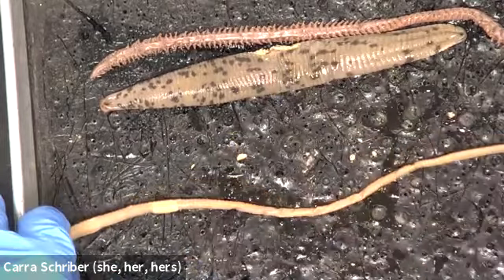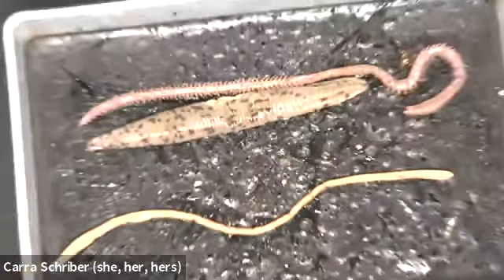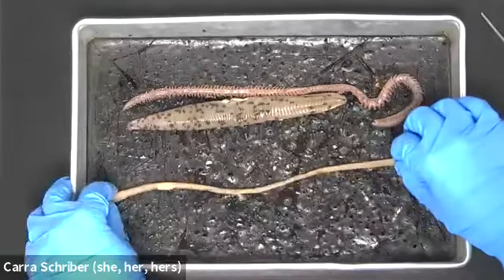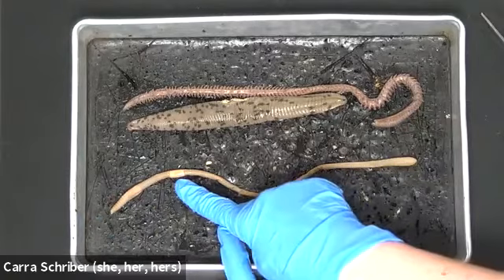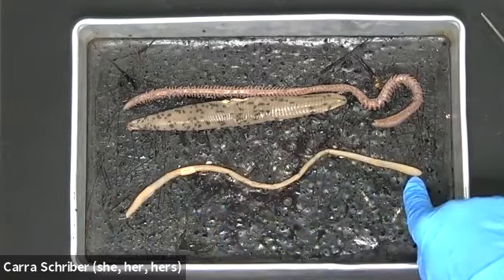So if we looked at the entire length of this, and I could just zoom out and that would help us, I know that because that's there, this has to be the mouth end. And because this is all the way over here, it can't be that the mouth is here because it's too far away.